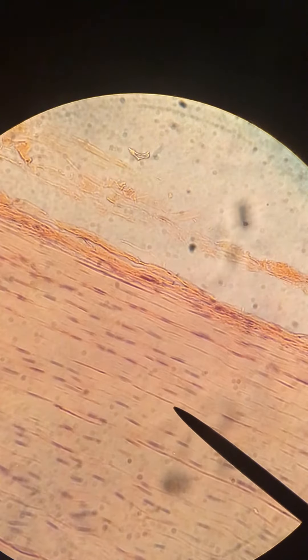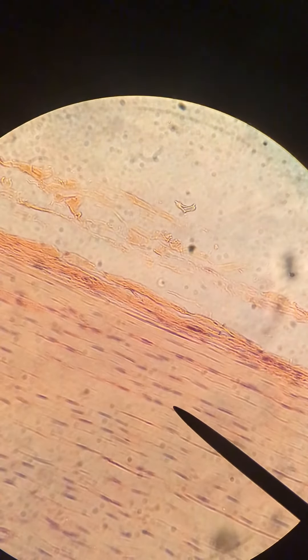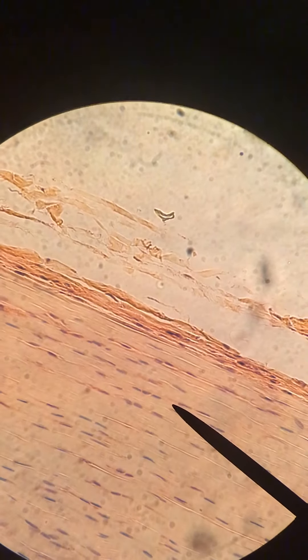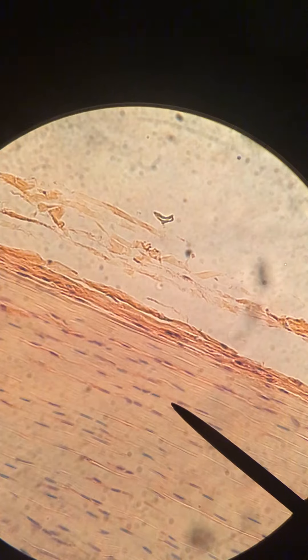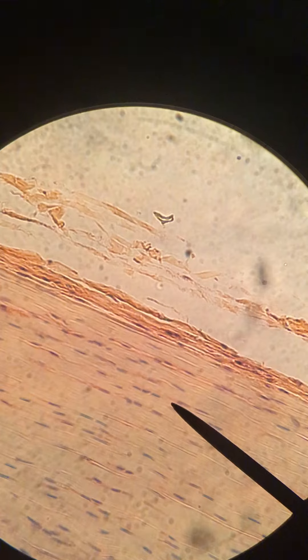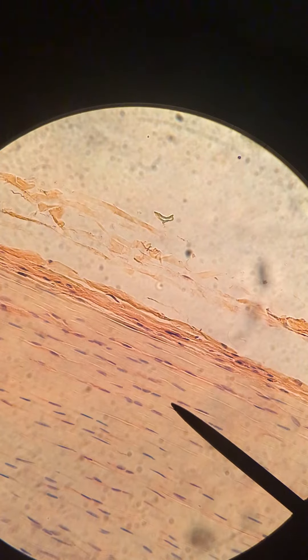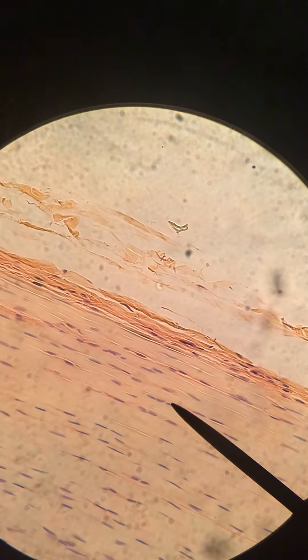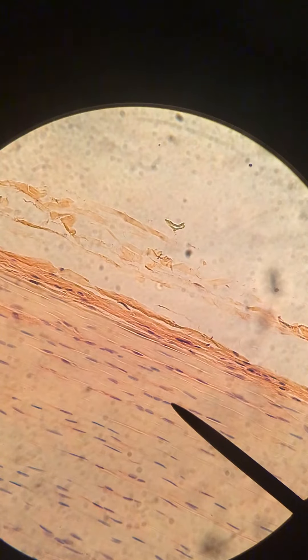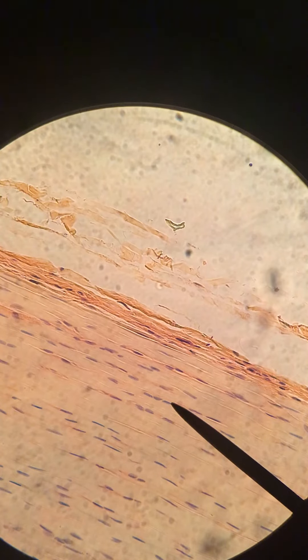The nuclei that you see here are belonging to the fibroblasts, which produce the fibers in our dense connective tissue. I will just mention that I often find that students confuse regular dense connective tissue with smooth muscle. They do look similar, but one tip I like to give everyone is that the nuclei in regular dense connective tissue tend to sometimes occur in sets of twos or threes.